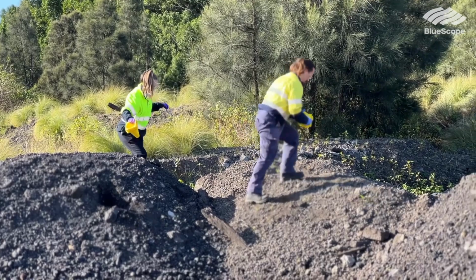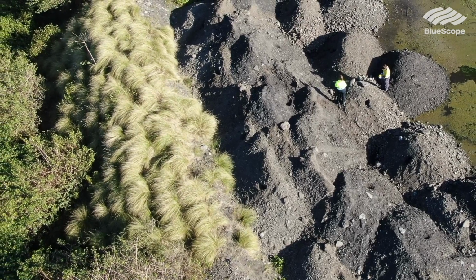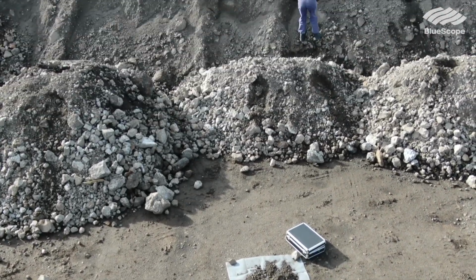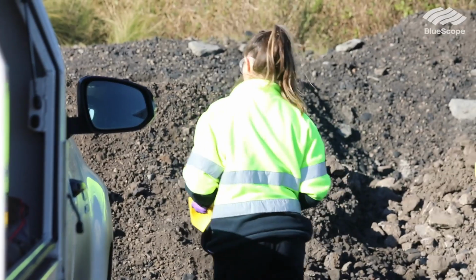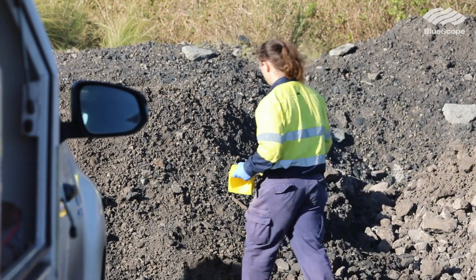So after we've received an analysis requisition for this type of sample, we'll gather up all of our tools in the lab and usually come out on a nice, clear, calm day like this. And then we generally start by looking at the pile and seeing where the best spots to take samples from are. And then we set out a plastic sheet on the ground and then go around to those different areas, placing a yellow cone down to make sure that we've taken samples from that spot.